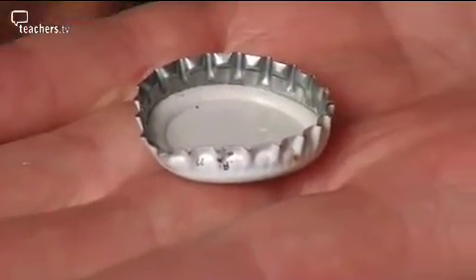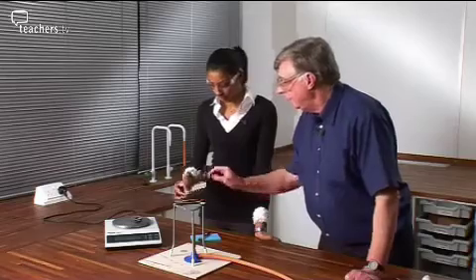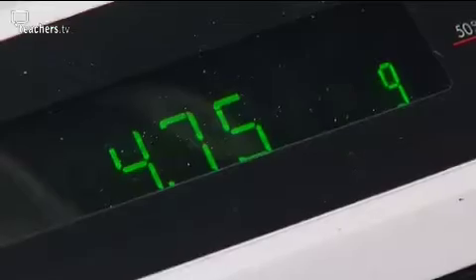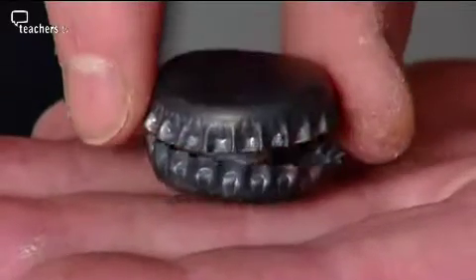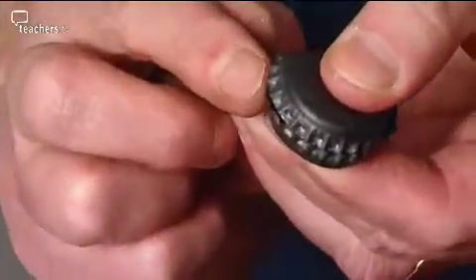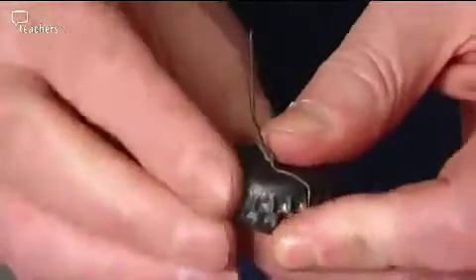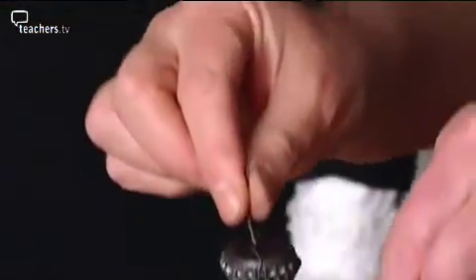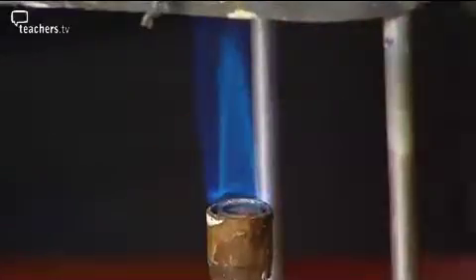It's important to remove the plastic insert. Onto the balance. To prove the method works, I'm weighing the setup first. 4.75 grams. I'm going to make a little parcel, like that, with the opening just there. And then place the little nichrome wire tie over the top. That just sits in there.